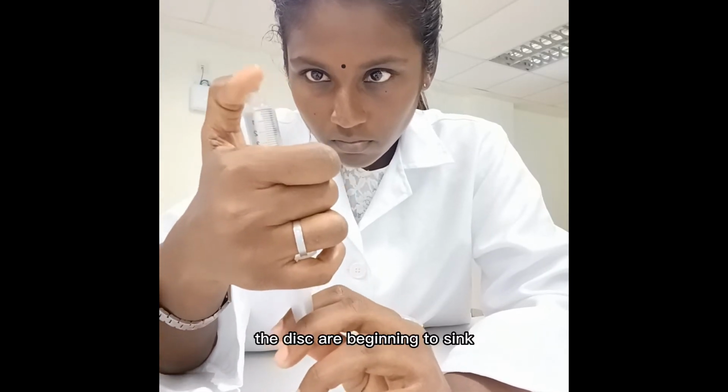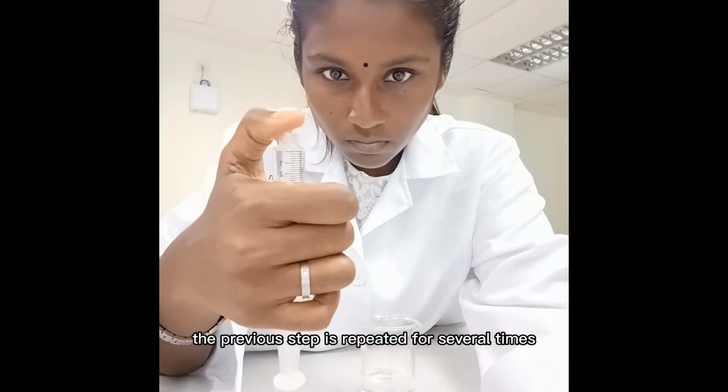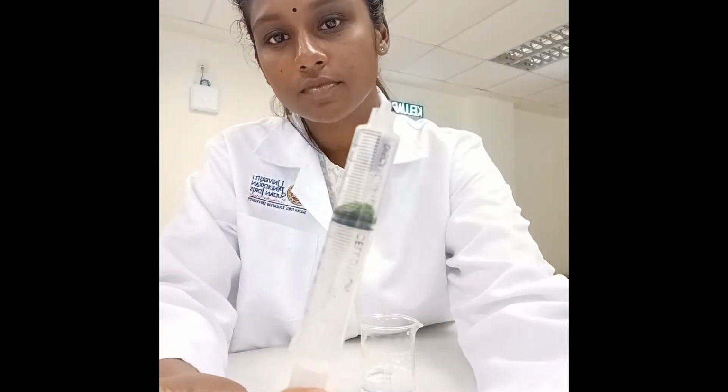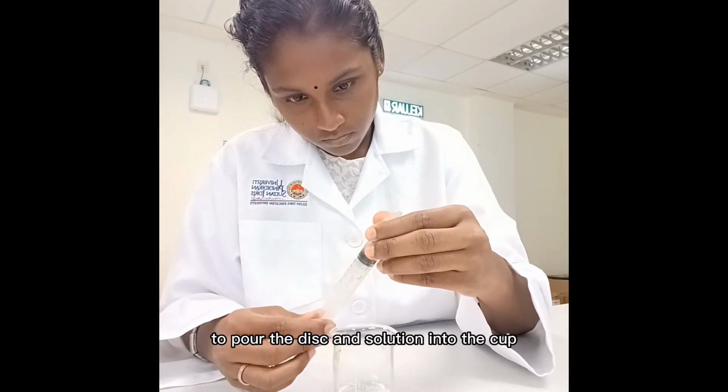The discs are beginning to sink. The previous step is repeated several times until all of the discs have sunk to the bottom. The discs have settled to the bottom. I'm going to remove the plunger to pour the discs and solution into the cup.